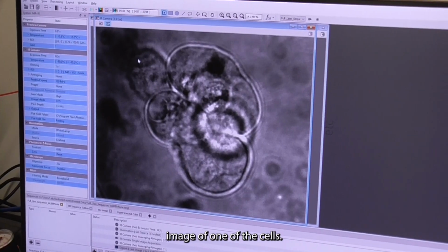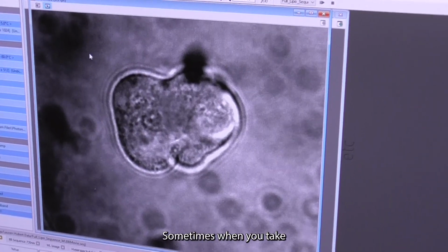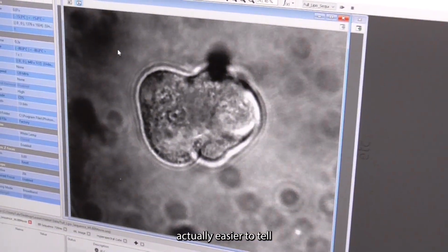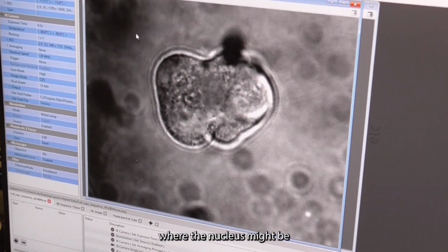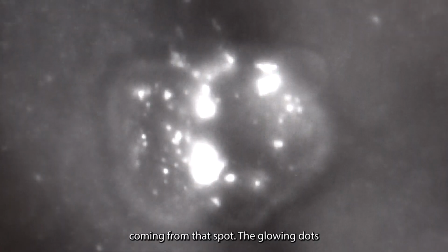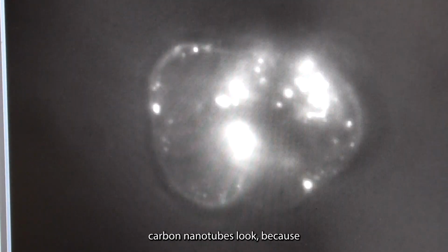This is a white light image of one of the cells. Sometimes when you take the fluorescent images with the laser, it's actually easier to tell where the nucleus might be because there'll be no carbon nanotube fluorescence coming from that spot. The glowing dots you see there are carbon nanotubes. I always love the way carbon nanotubes look because it reminds me of the stars in the sky.